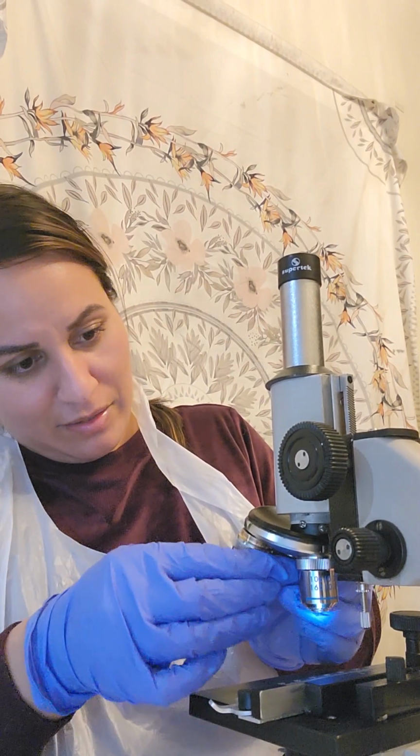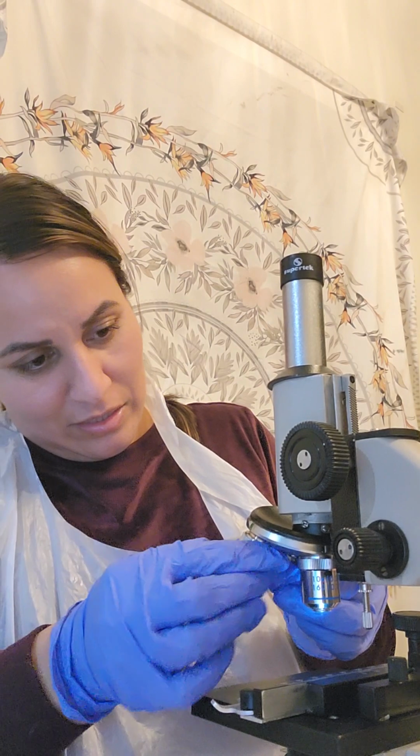Forgive me. Getting these lenses in is a little challenging sometimes. So the next one, let me make sure. I took a photo already. I uploaded it.